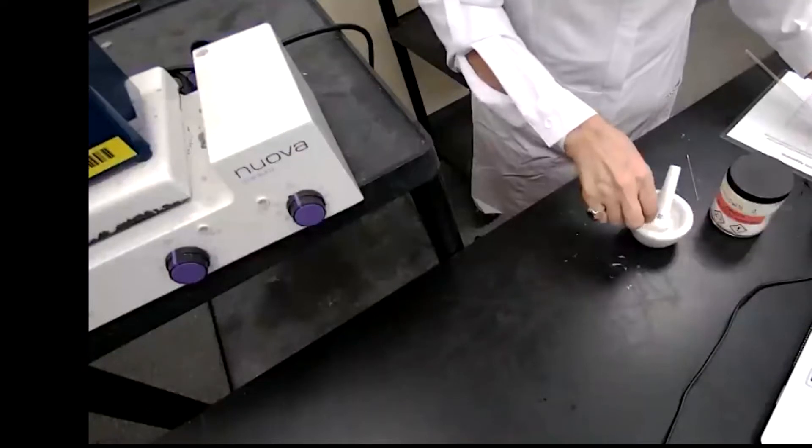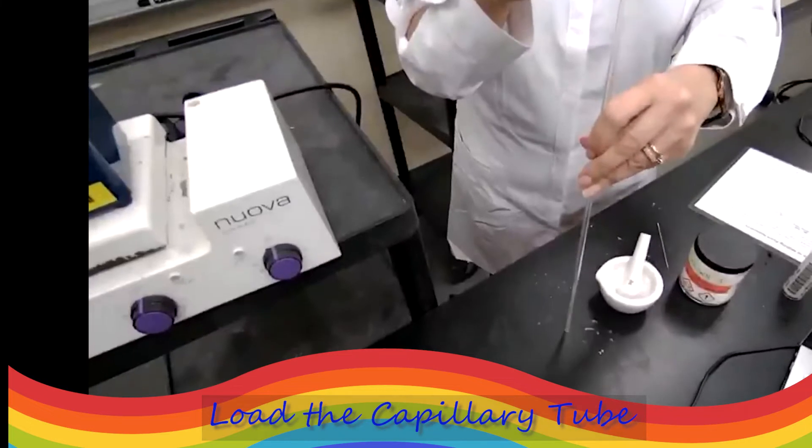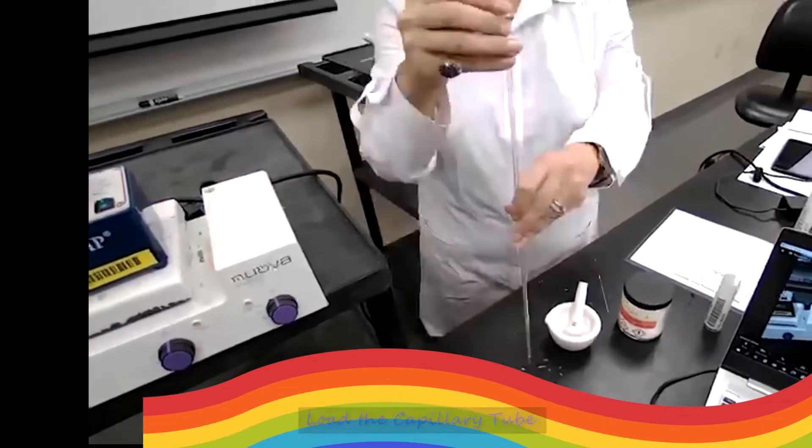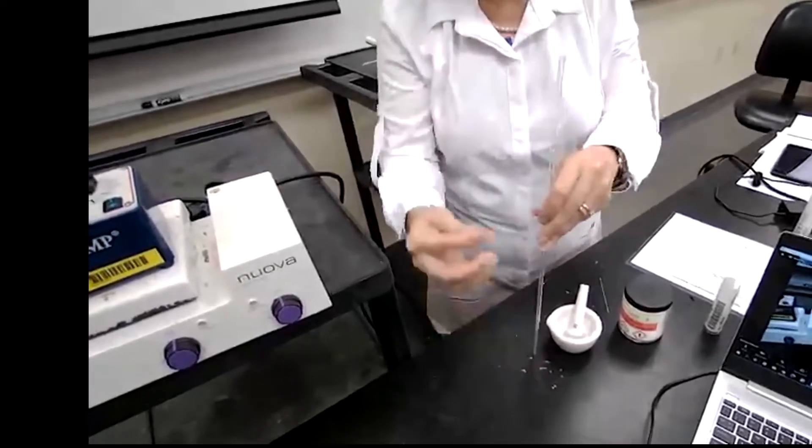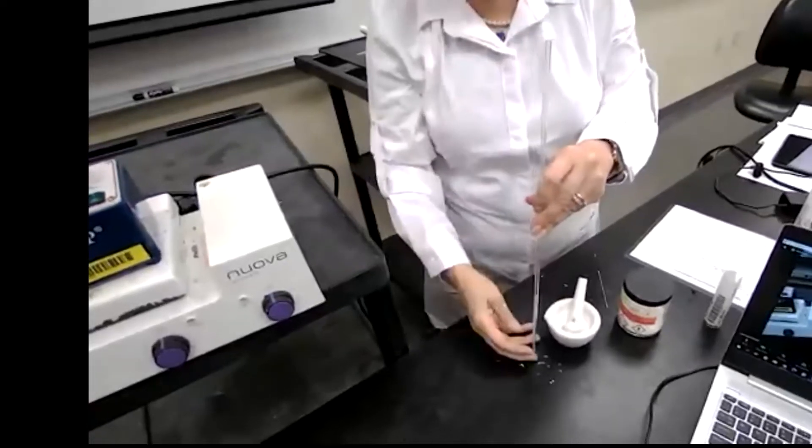With the two samples, I would do the first sample like a quick melt. The quick melt is going to give me approximate melting point for the sample.